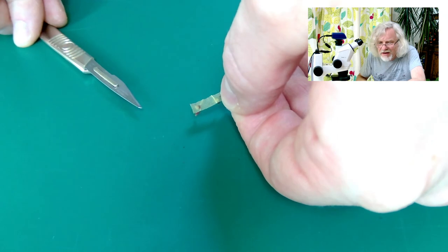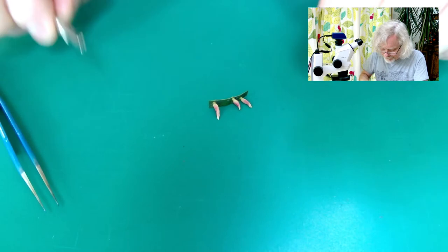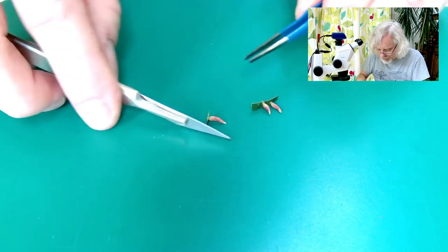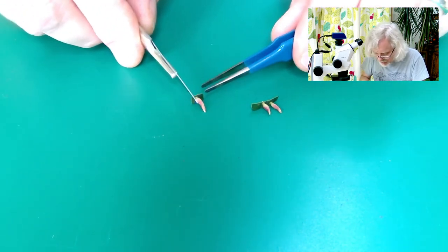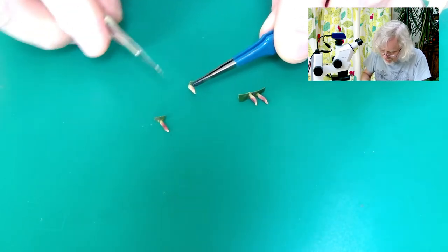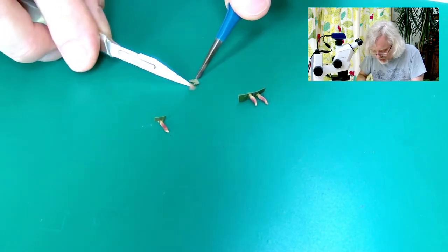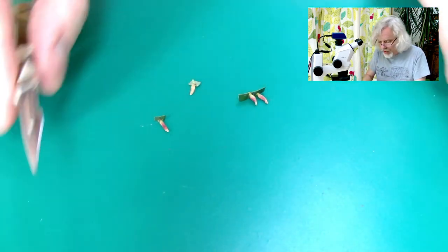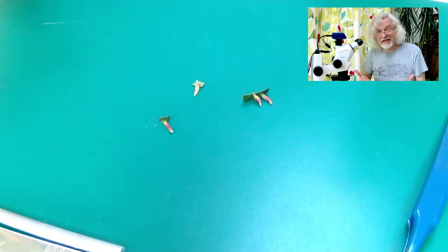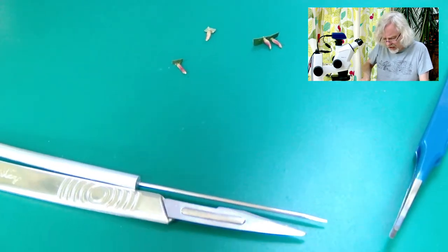You can see there's a sort of a dimple on the bottom as well where the nail gall is. Let's slice this one open. Right, there we go, and then we'll put that there. This one's conveniently broken away from its bit of leaf. Now I'm going to put the whole thing underneath the microscope. I'm using this green background because it creates better contrast — this camera can't cope otherwise because everything's quite dark as it's all covered in black soot.